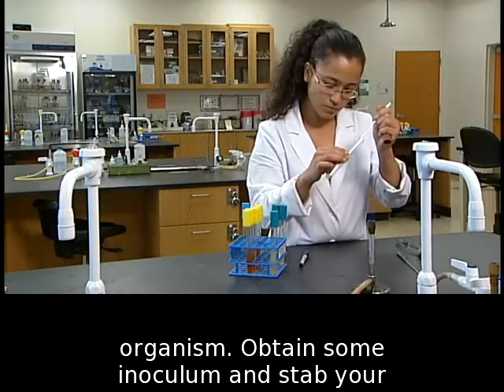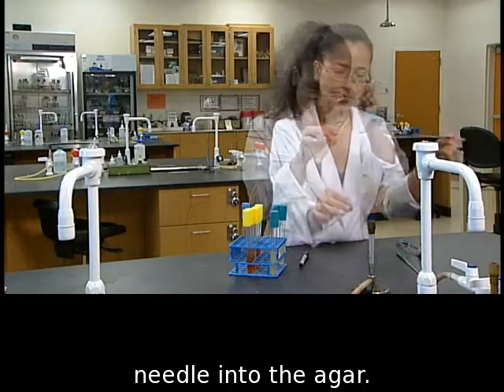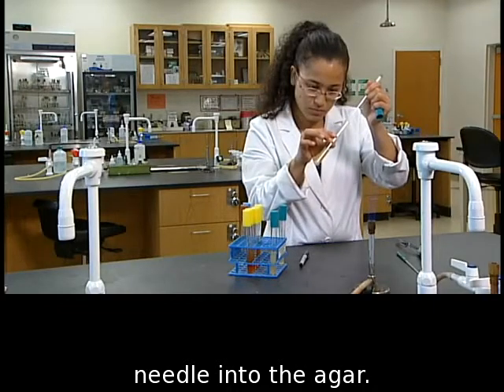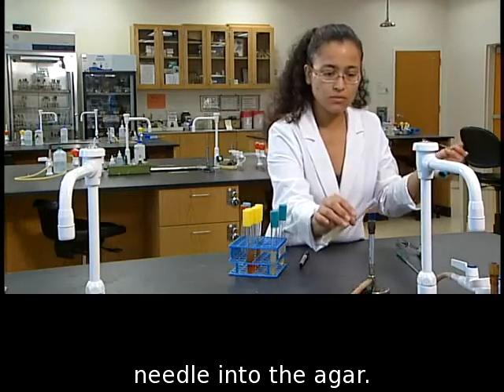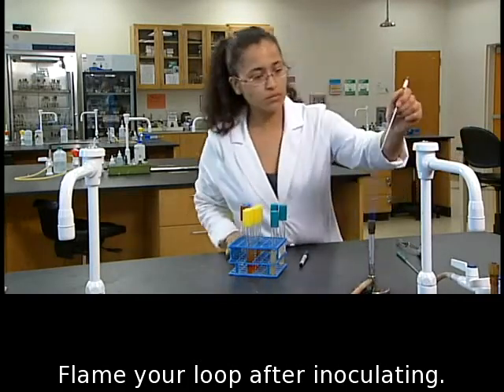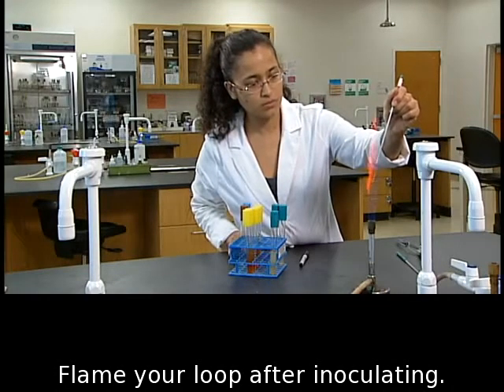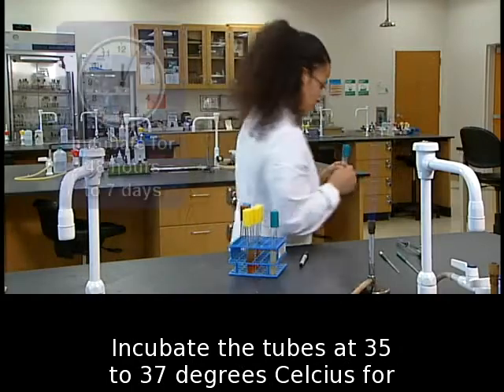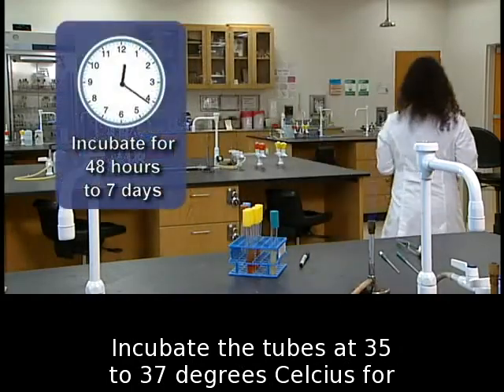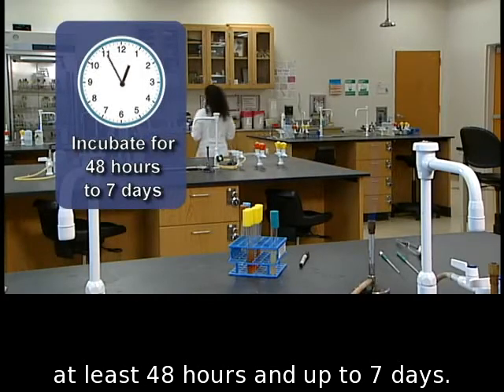Obtain some inoculum and stab your needle into the agar. Flame your loop after inoculating. Incubate the tubes at 35 to 37 degrees Celsius for at least 48 hours and up to 7 days.